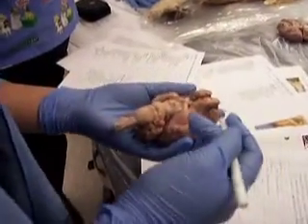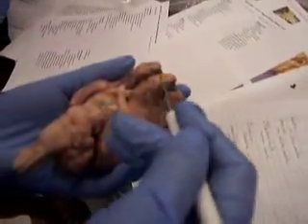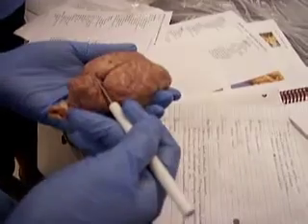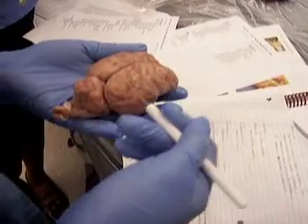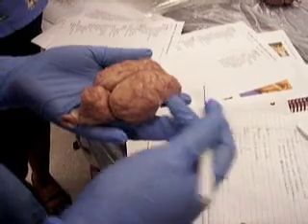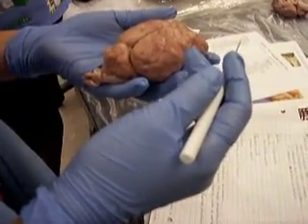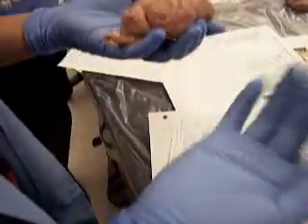Olfactory bulbs are these two right up front. Cerebellum actually coordinates motor skills. Cerebrum is when you think, this is what you use. I think of X-Men, he uses the machine Cerebro. So when he's thinking, the Cerebro. See? I knew it would work.